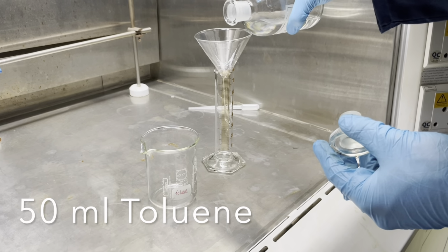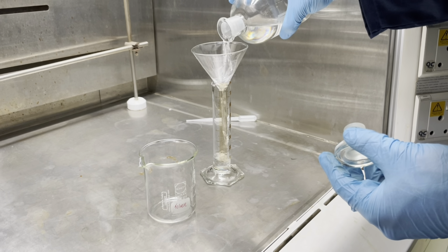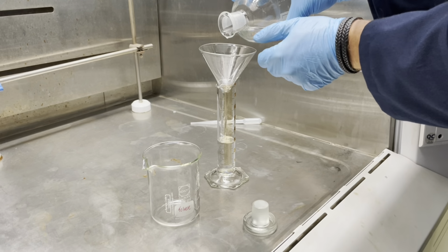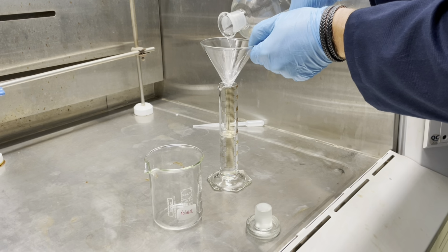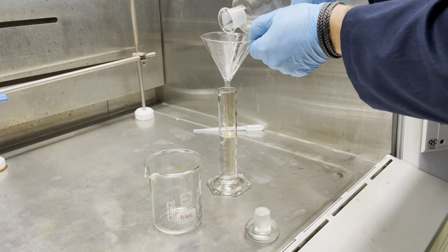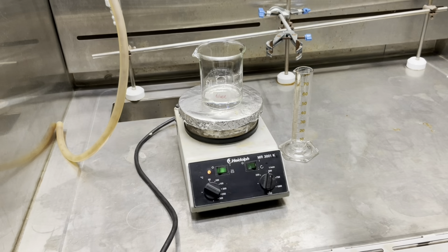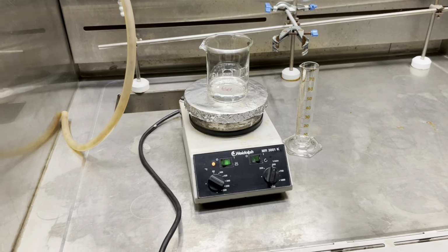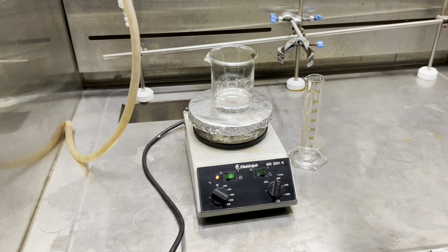Next, we will start with our purification steps. First, in this, we will need to collect toluene. Again, using our measuring cylinder and a funnel, we will collect toluene from the reagent fume hood. Place your toluene on a hot plate and cover it with a watch glass to start the boiling process while your crude product is drying in the oven.